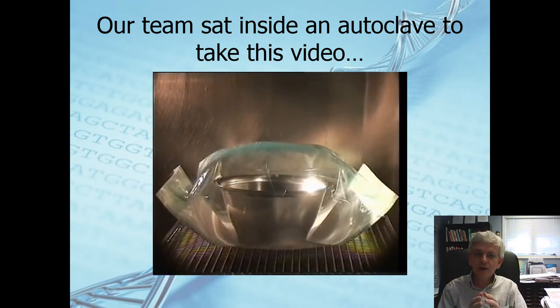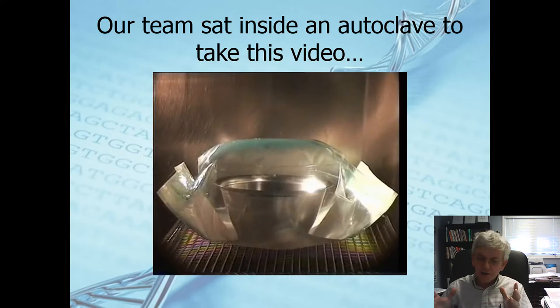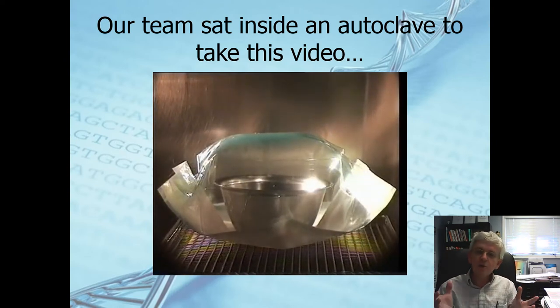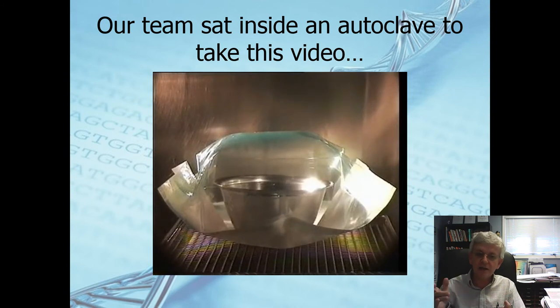What's going on? Did you have any idea? The bag for this bucket that's sitting in there, look at the size of this thing, how big it's getting.